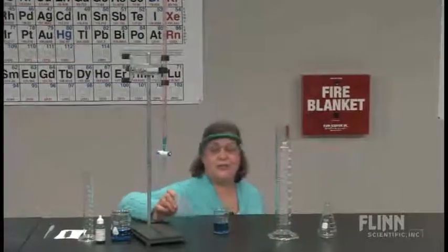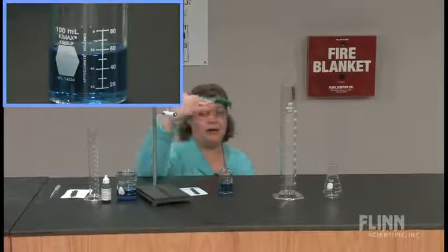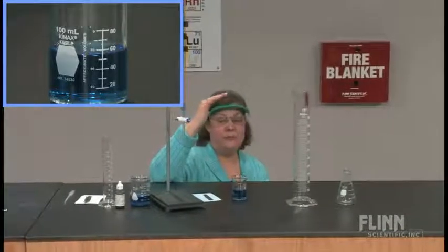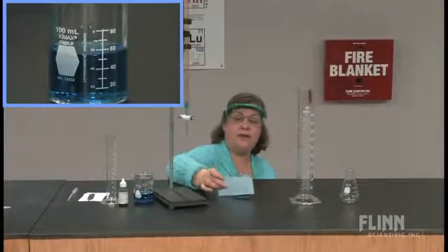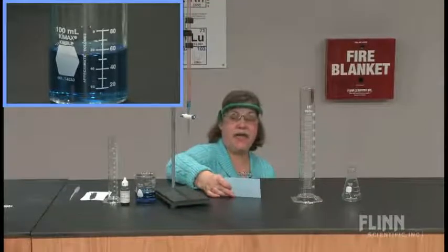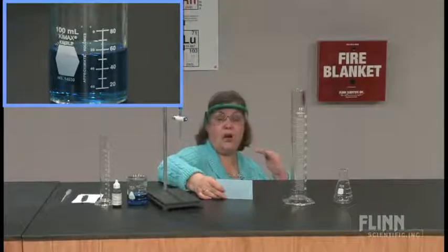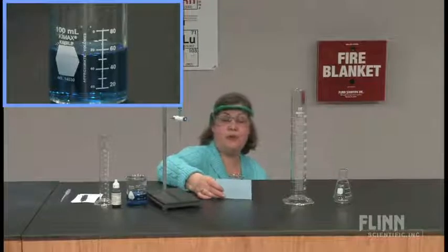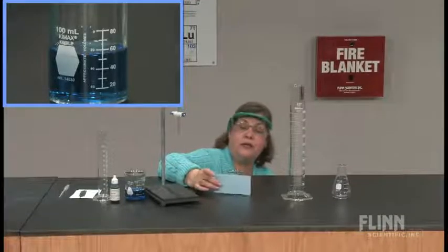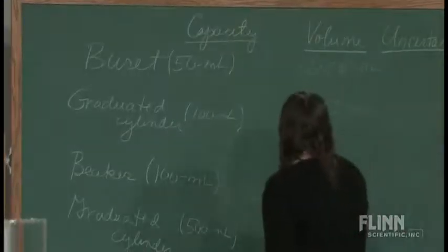And again, I probably don't need this because this is way too much, but now my major markings are only 20, 40, 60, 80. Then there's a minor marking for 10, 30, 50, and so on. So I can only read it to really 1 milliliter, because that's a big estimate. So it's beyond the 50 minor marking, and it appears to be halfway between the 50 and the 60. So I can only estimate that really to 1 milliliter, and since it looks halfway to me, I'm going to say 55. So let's call that 55 milliliters.